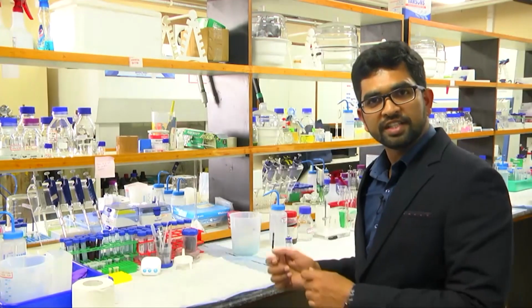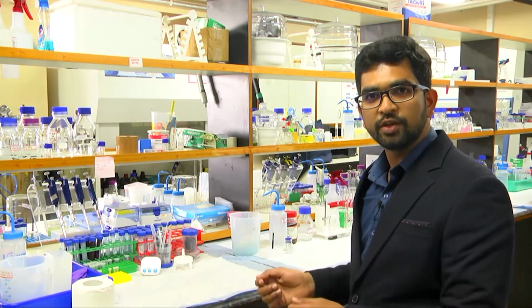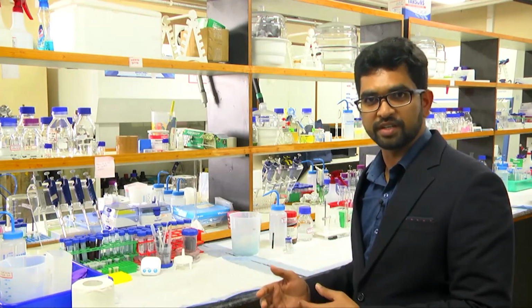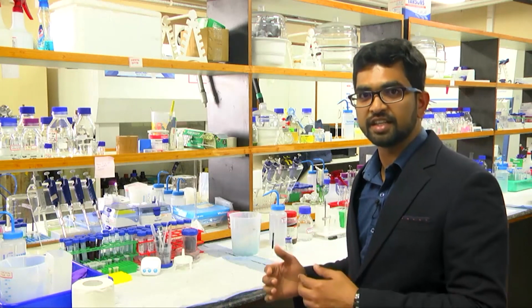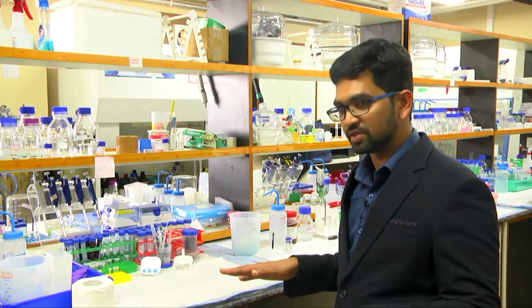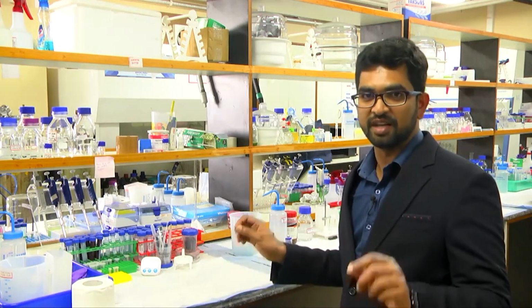So all my teaching assistants are here today. They will demonstrate all the basic technologies like cyclic voltammetry, chronocoulometry, chronoamperometry, and the electrochemical impedance that can be useful for sensor development. So let's start our lab today.